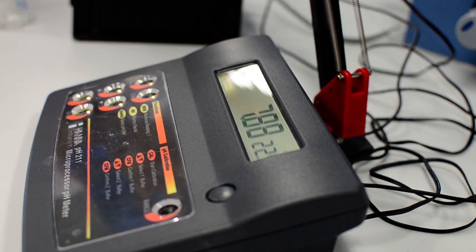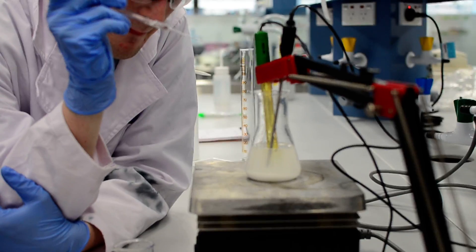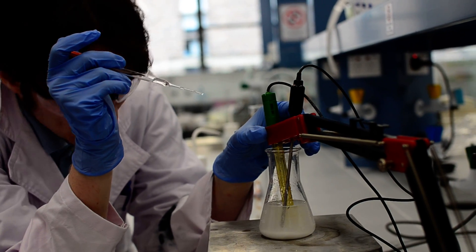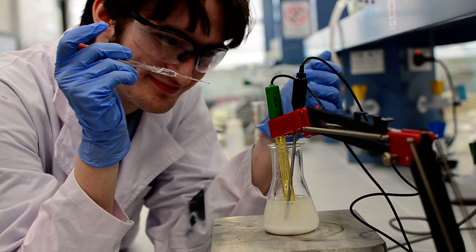It's even lower than it was before. That's because more and more is becoming insoluble. Alright, I'm going to lunch. Bye.